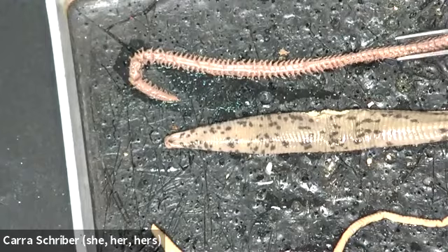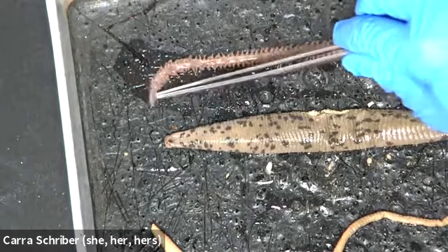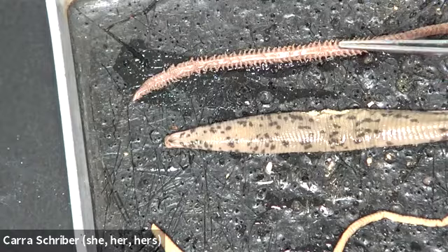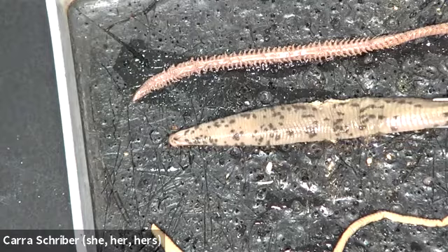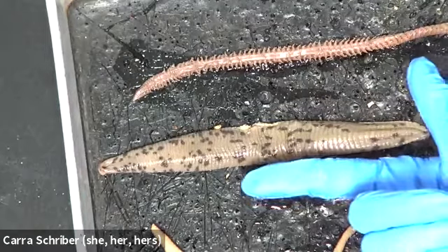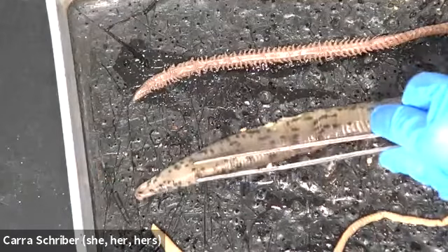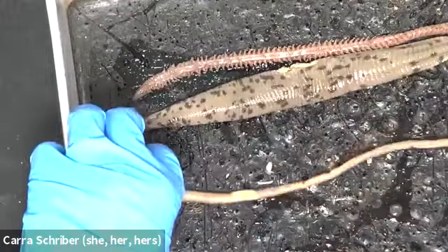So here we have a ragworm. And you hopefully can see that it has little segments, and little hairs that stick out on the sides here, but each of these different hairs also represents a different segment of the organism. This is terrifying. This is actually a humongous leech, okay? That's a very large leech. I'm just giving my finger for size here. And so the leech is a segmented worm as well. And then the last one that we'll look at here is an earthworm.